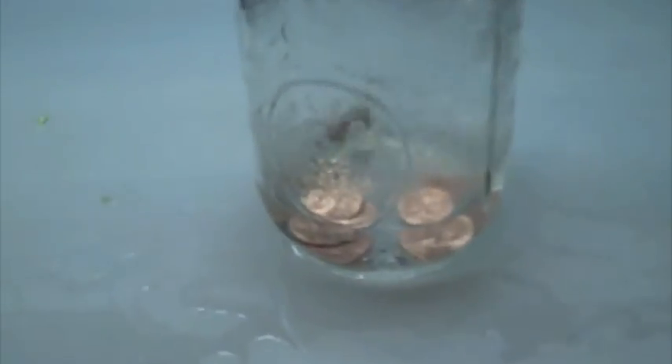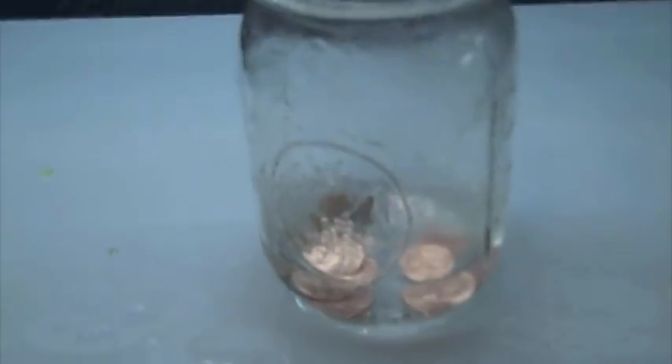After adding your copper, the solution will turn blue — it won't turn blue instantly. Wait about 3 minutes, and the solution will start to turn blue from the copper acetate formed. I'm going to skip ahead a couple minutes so you guys can see the copper acetate solution and the color.